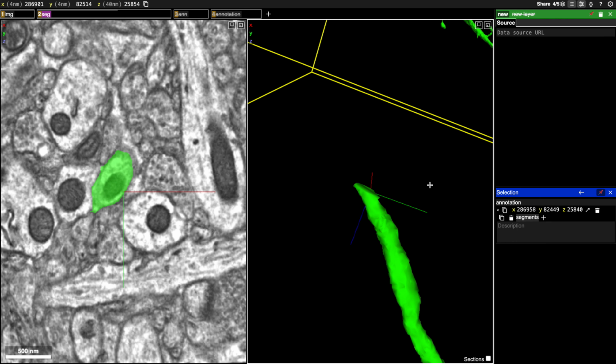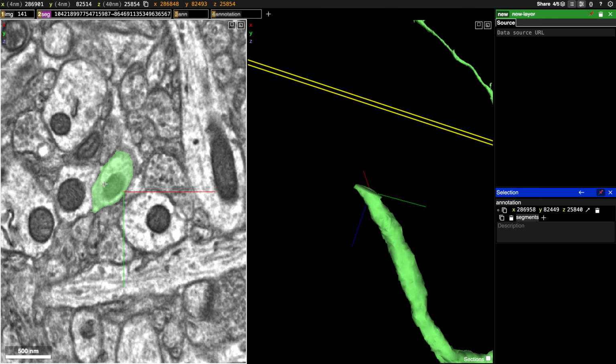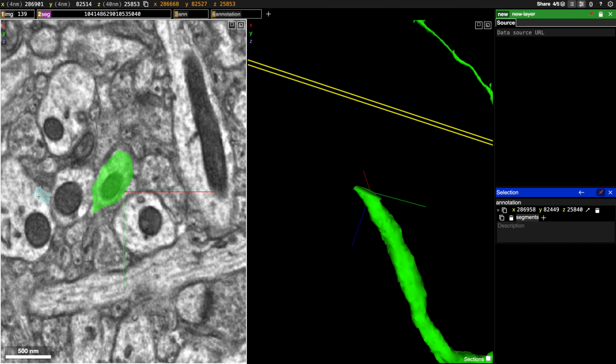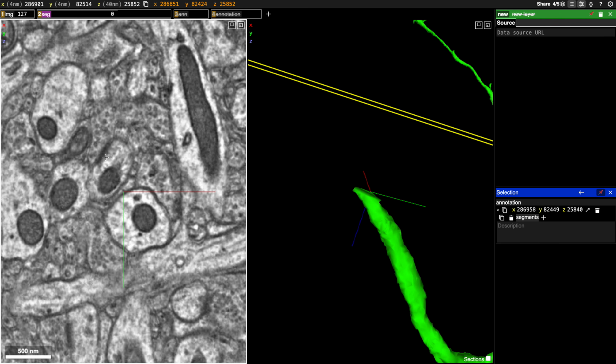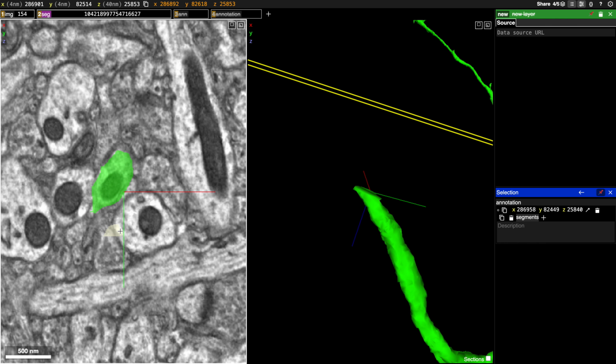All right, so here we have a branch that has terminated early due to a slide misalignment. We're going to take a look over here in the EM images. And as you can see, when we scroll through, the slide is jumping and all of the images are jumping downwards in this direction.